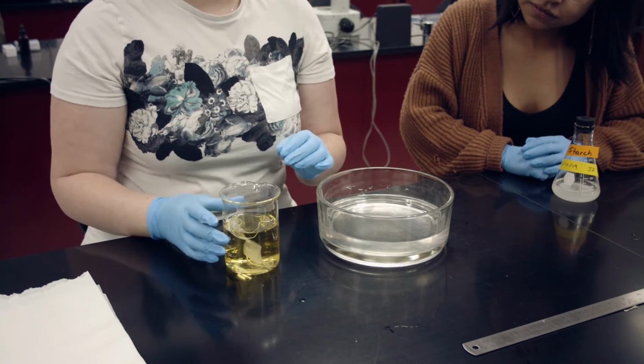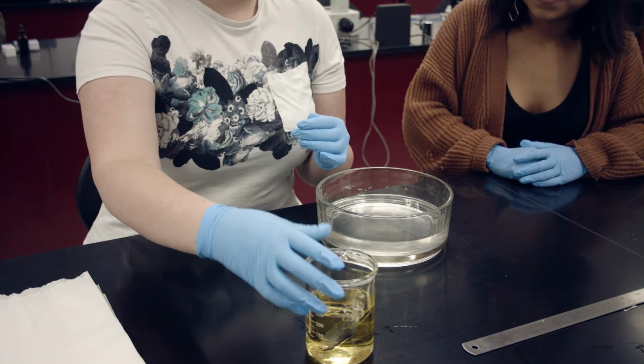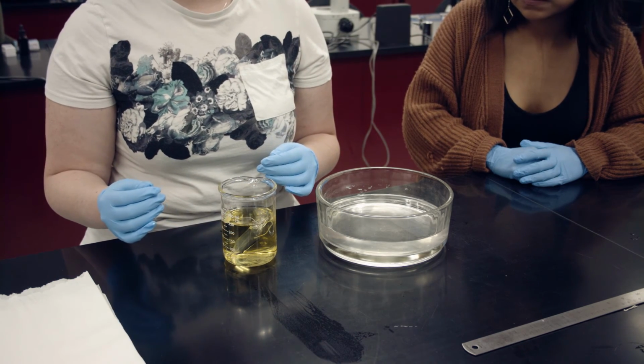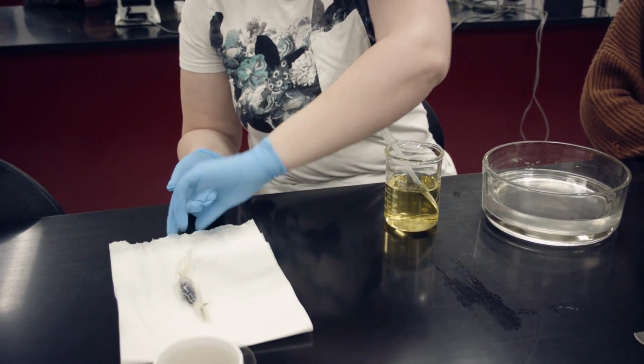As you may remember from Lab 3, when iodine and starch come into contact with one another, a dark blue-black color is produced. Monitor the color of the beaker solution and the dialysis bag solution over time. Be sure to record your results and then proceed to data analysis.